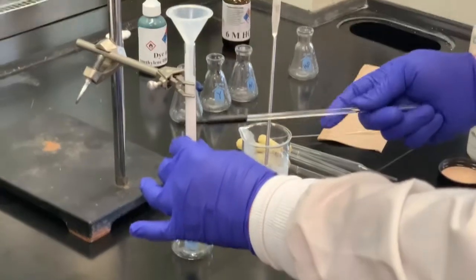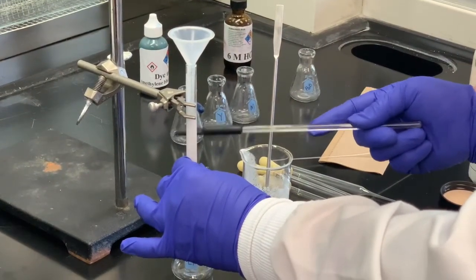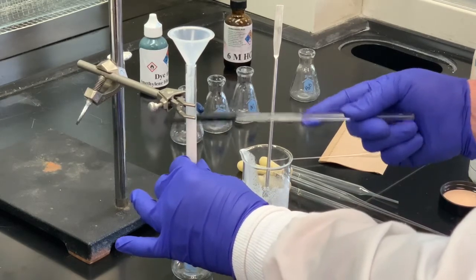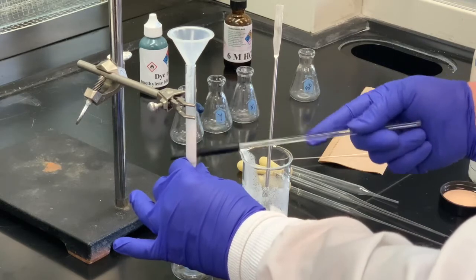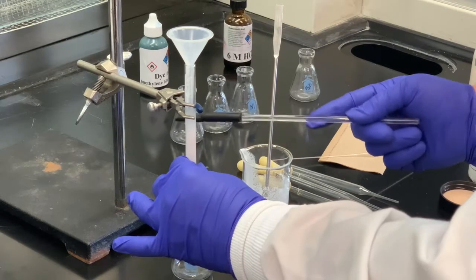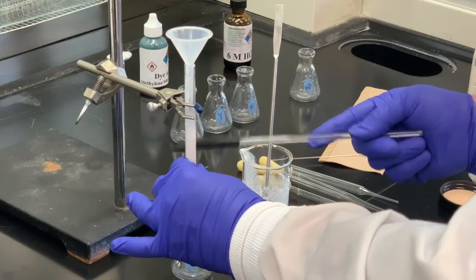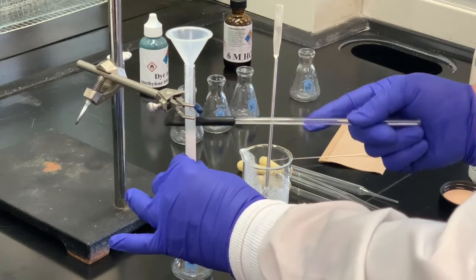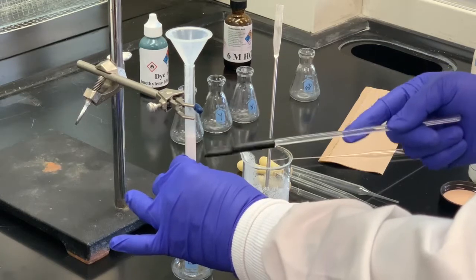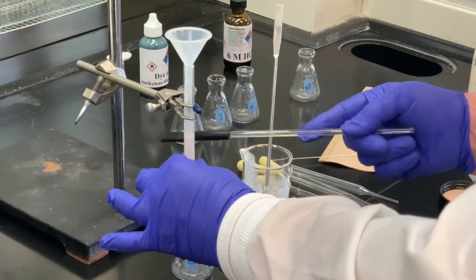And then as this is settling, I just want to tap the sides. And the purpose of tapping the sides, if you don't do this, you want it as packed as well as possible, as tight as possible. If you don't do this initially, it's possible that during the experiment, you may get air bubbles or chambers that develop and then your separation isn't going to be very successful.